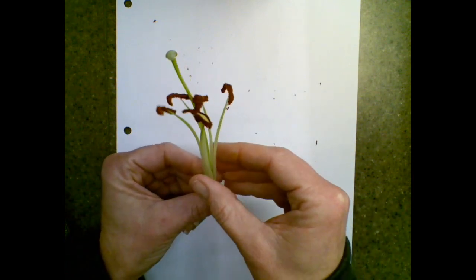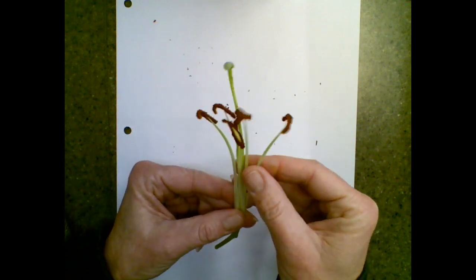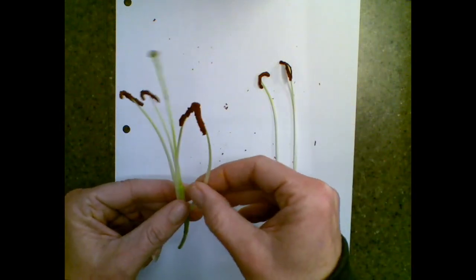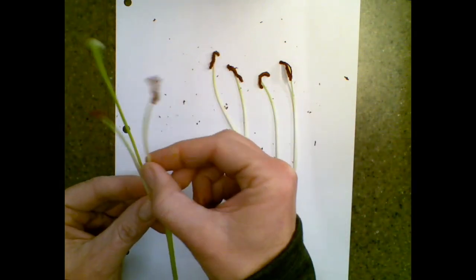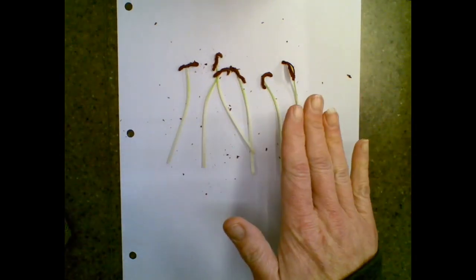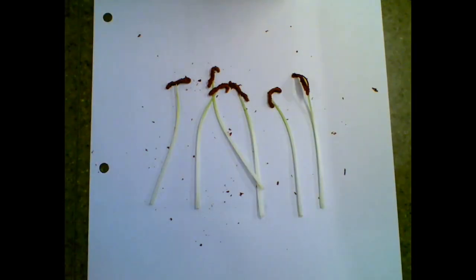So there's 2 different things. You can see it really clearly on this flower. This is a lily, that's why I chose it. These are the male parts. Oops, one just fell off. There's 1, 2, and I'm just going to pull them off. Sorry, plant. 3, that's sperm everywhere. This is sperm. 4, 5, 6. Once again, everything's in multiples of 3 because this is a monocot. If this was a dicot, it might have multiples of 4, so maybe it would have 8 of these. Or multiples of 5, so it might have 5, or it might have 10 of these.